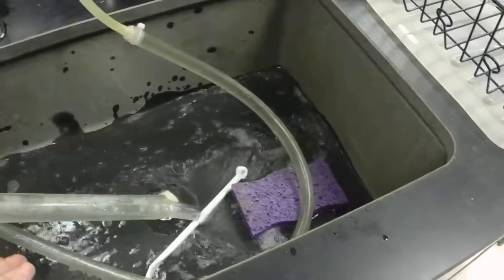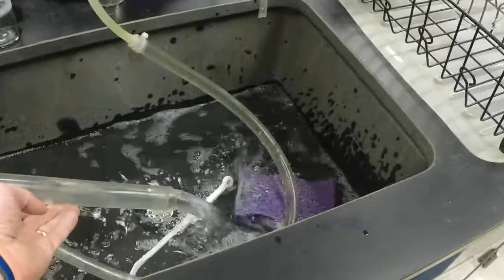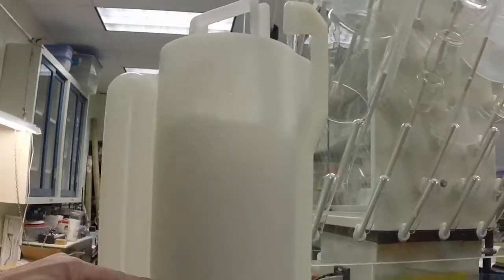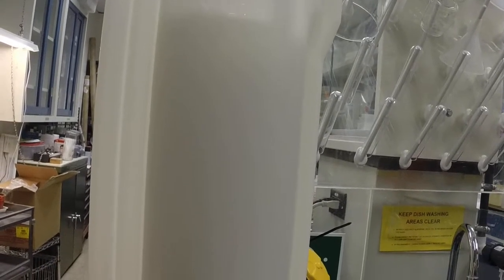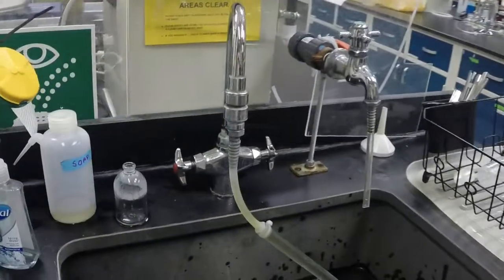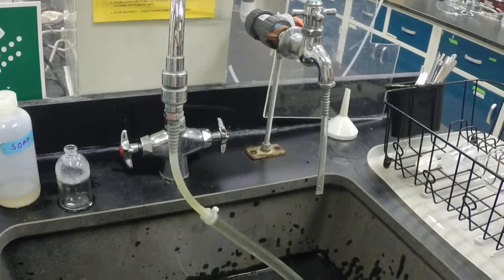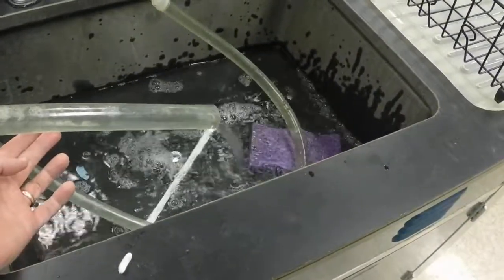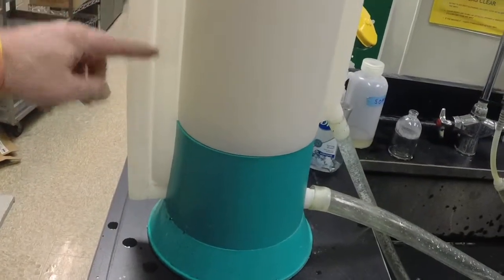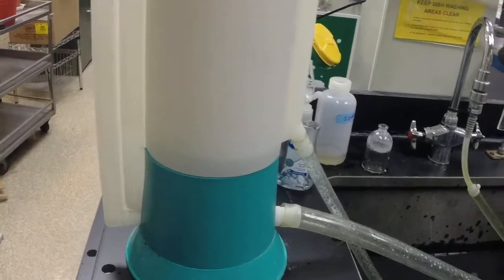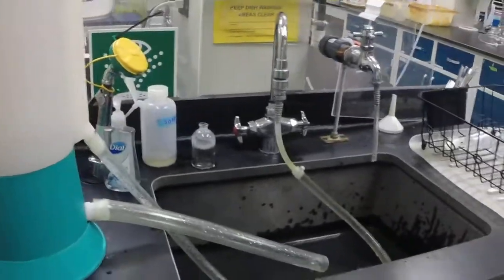You can see it now going down rapidly, so what's happening here is that it'll go very fast. The siphon breaks—once the siphon breaks you'll see in a second here that siphon now will break over here and it'll start to refill the bucket.